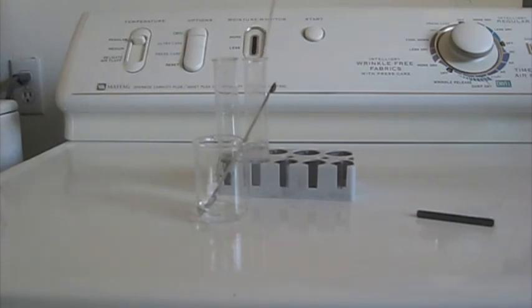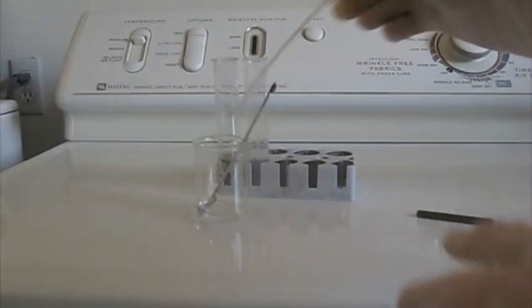Now take a small amount of that and transfer it to the test tube with hydrogen peroxide and corn starch water.